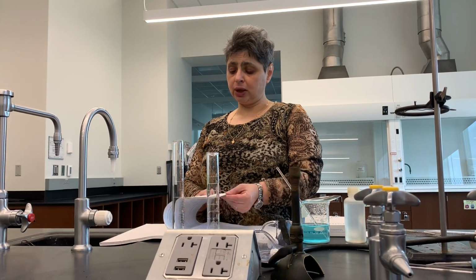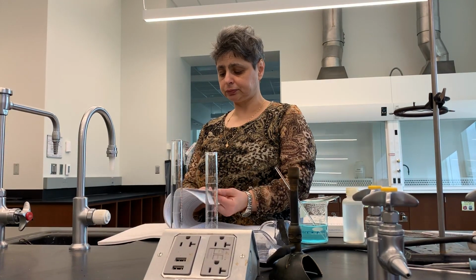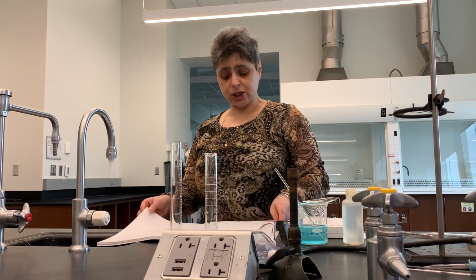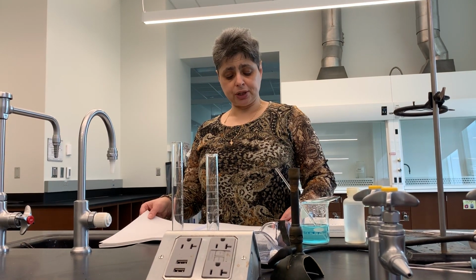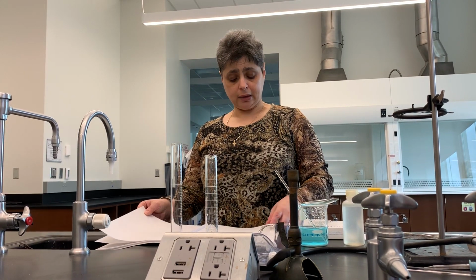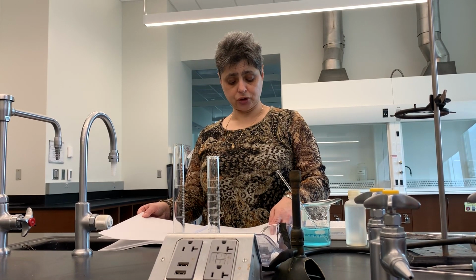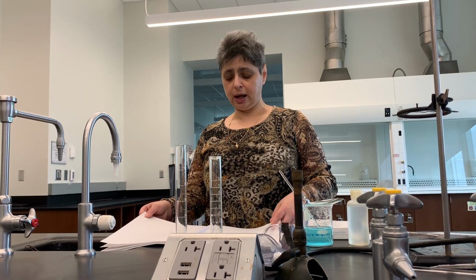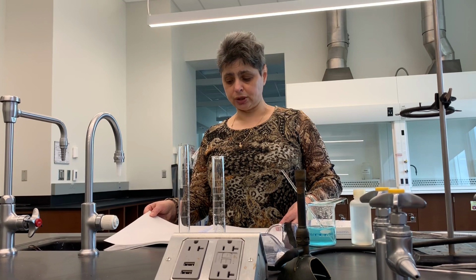So let's quickly review the data sheets. Data sheet 1, which is page 100, will include mass percentages of sulfate, copper, and ammonia. You will also enter the empirical formula, and then show how you found it at the bottom of data sheet 1. I left enough room, I hope, for you to do these calculations.